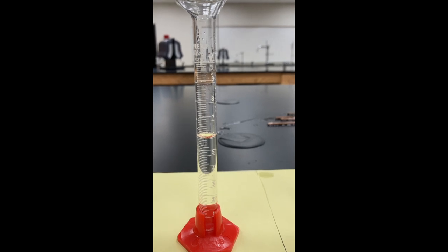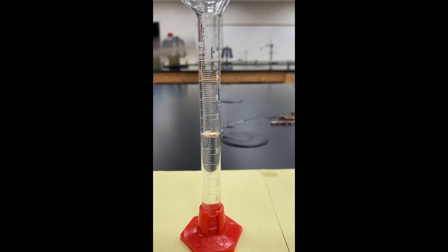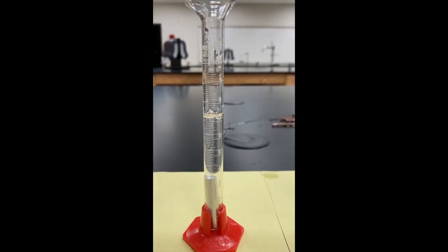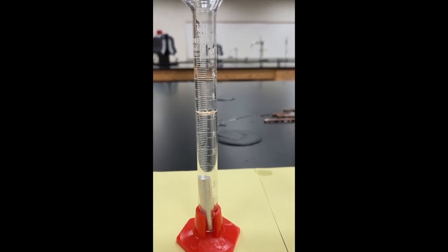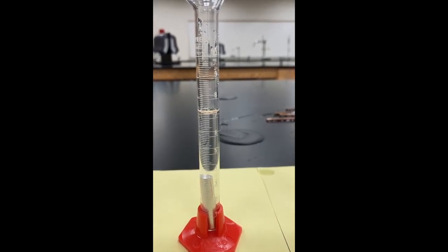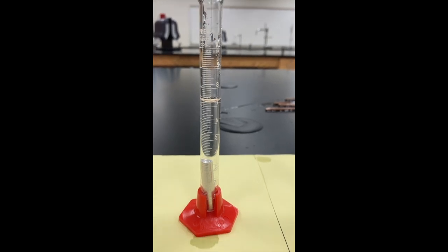Piece number three. Take piece number three here, we'll stick it in, we'll let the bubbles clear out, and take a guess at your volume for piece number three.